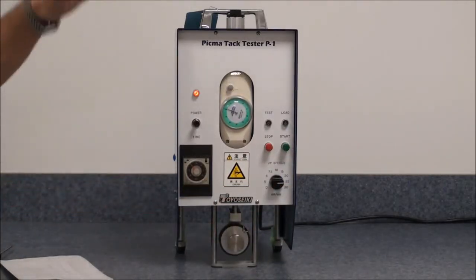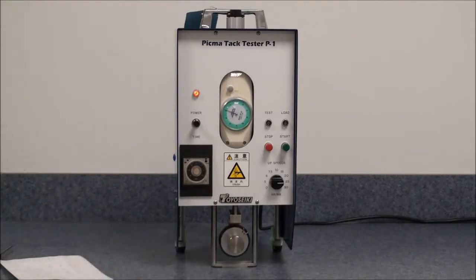The sample will then lower itself to the contact surface to a load of 4.9 newtons.